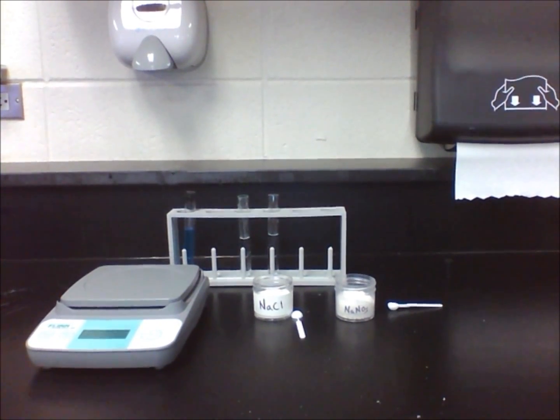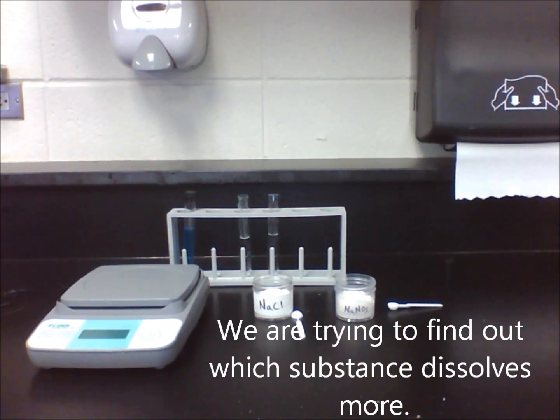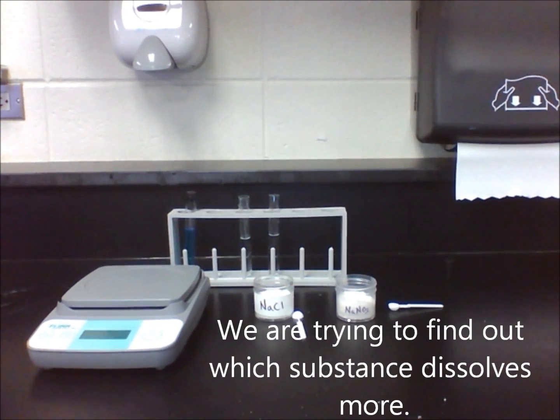In lab 13.2, we are going to find out how much of two substances, sodium chloride and sodium nitrate, will dissolve in equal amounts of water. We will need to measure the amount of solute dissolved for each substance in grams.